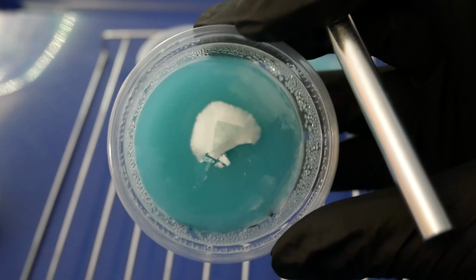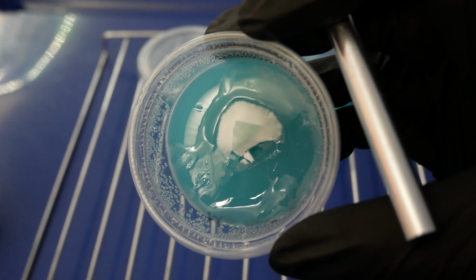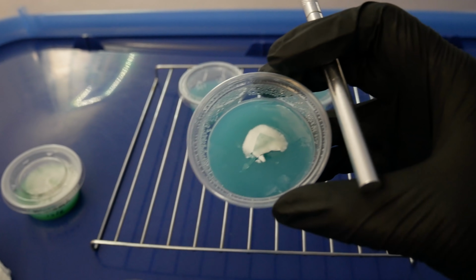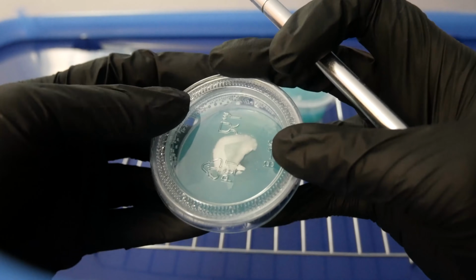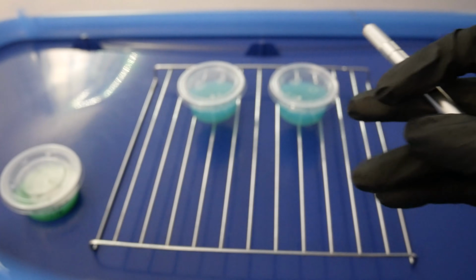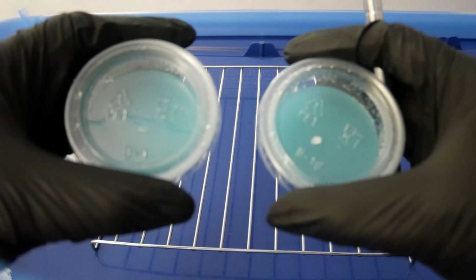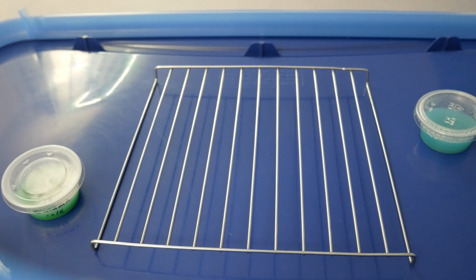You can see the cuts that I've made are away from the areas that have the slime goop. It's kind of hard to tell. If the slime ends up showing up again on the new plates, then we'll have to clean them up again. But for now, we've got our transfers out. Here we go. All right. We'll move on to the last cup here.